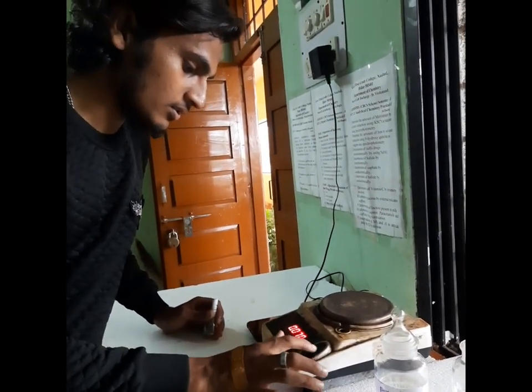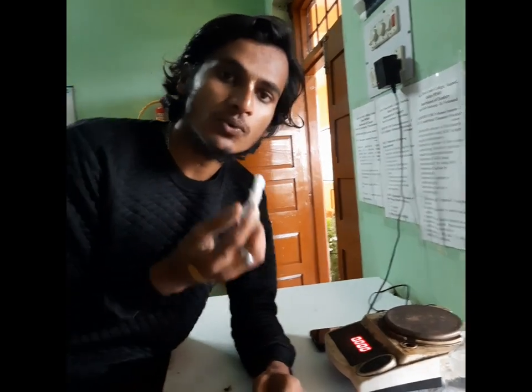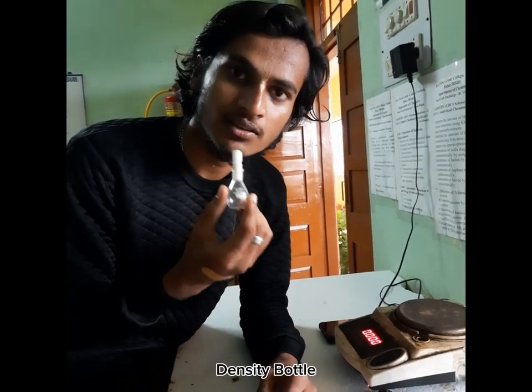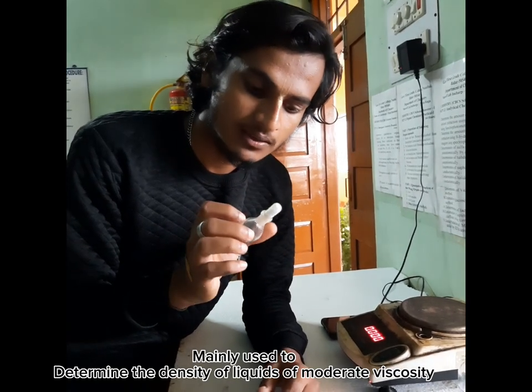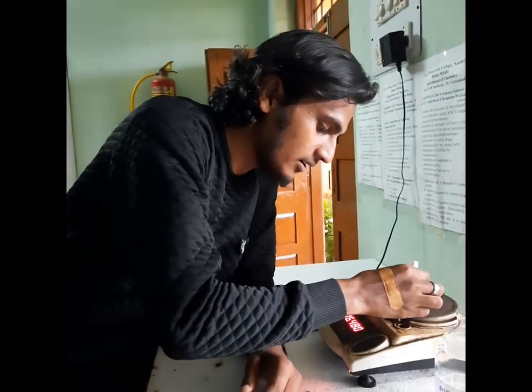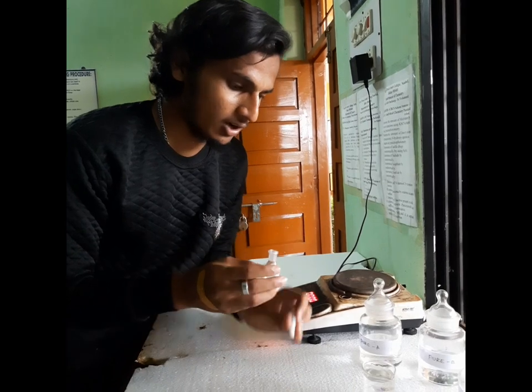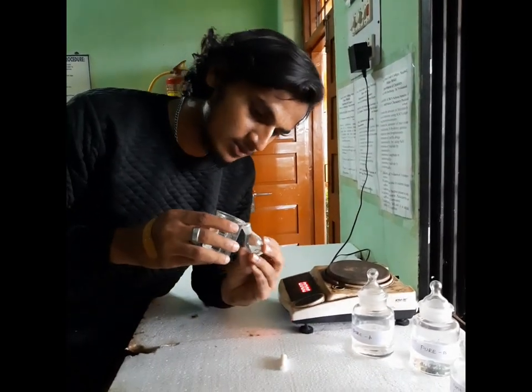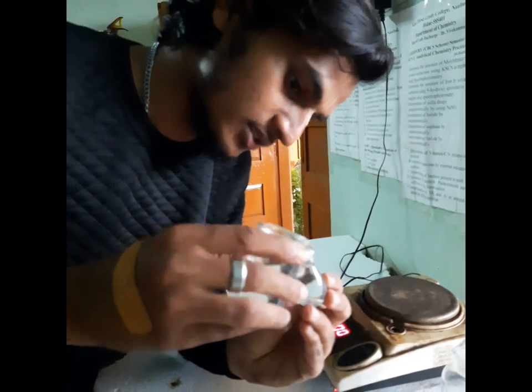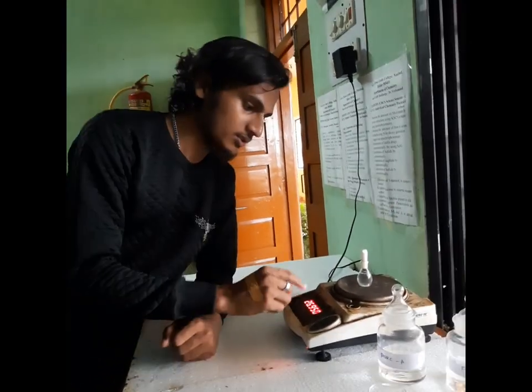Now, the first step is we need to weigh this empty specific gravity bottle. This bottle is also called a density bottle and we use it for calculating density. After weighing the specific gravity bottle empty, we need to calculate for distilled water.